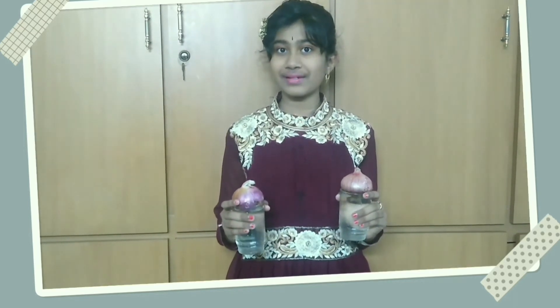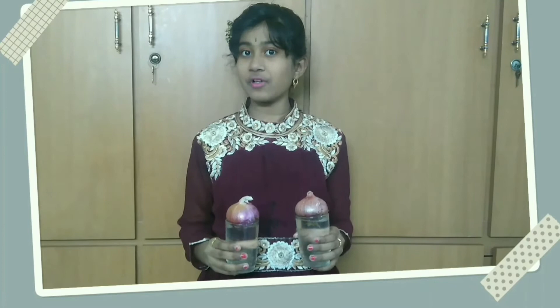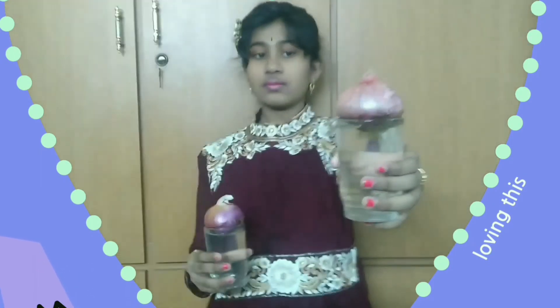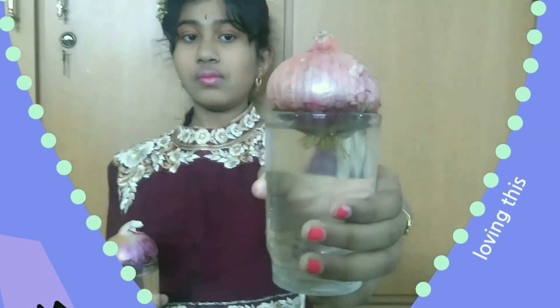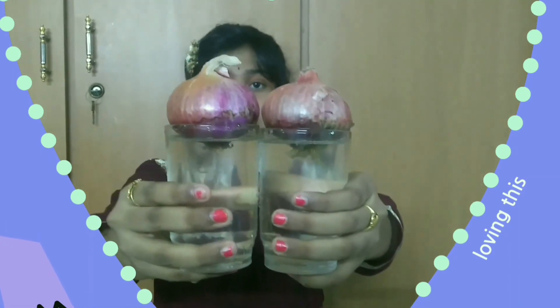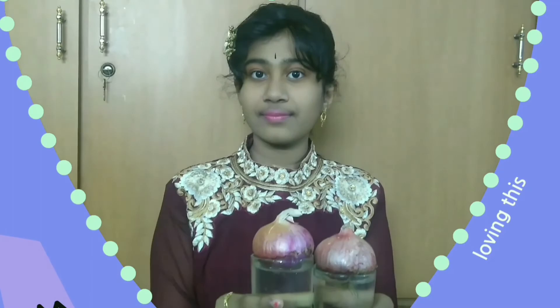Today is the last day of the experiment. Yesterday we cut the tips of the roots in this jar. In this jar we have not cut the tips of the roots. Do you observe the difference in both the jars? Yes — the roots are shorter in this jar than this one. Do you know why? Because we have cut the apical meristems. In jar 2 we cut the tips of the roots, and that is the reason the roots stopped growing.